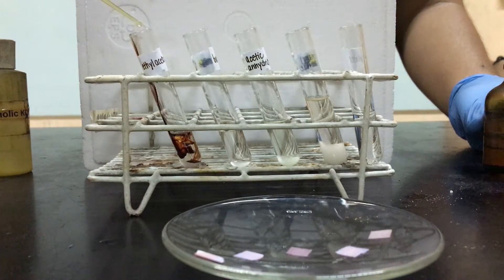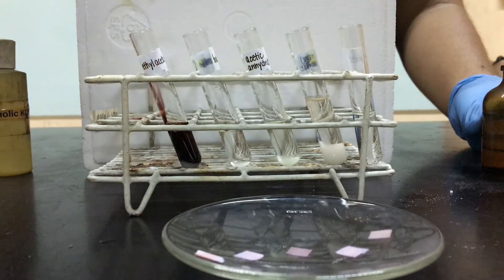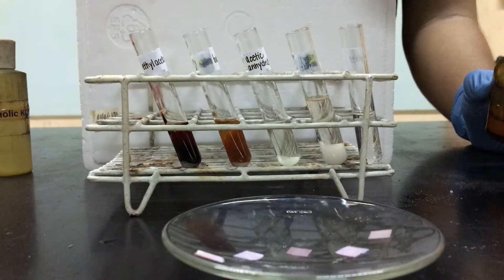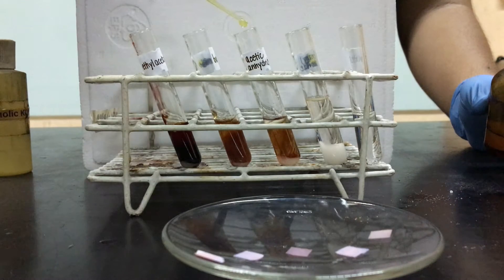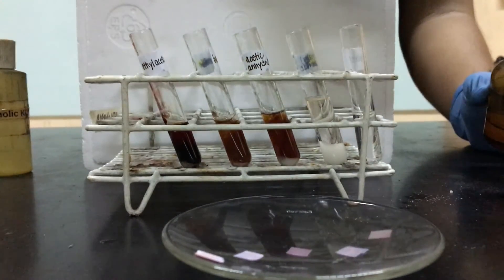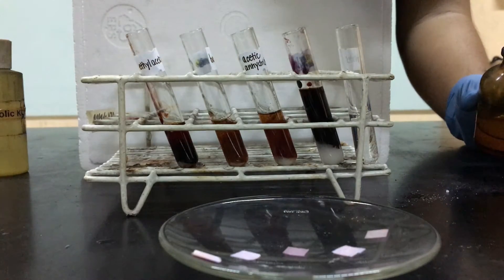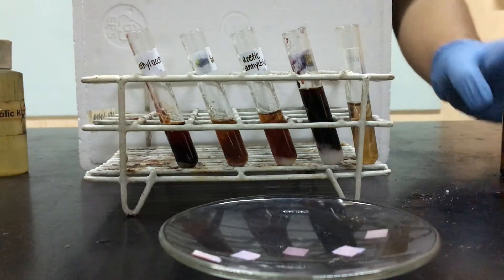Ethyl acetate produced a dark reddish brown color. Benzamide and acetic anhydride produced a reddish purple color. Water produced no color. The reddish brown solution you see is the color of the ferric chloride reagent.